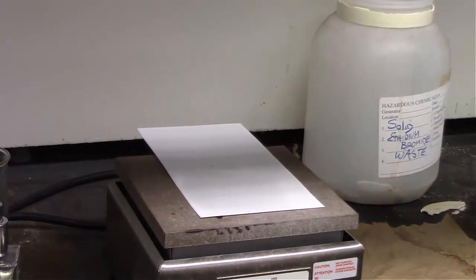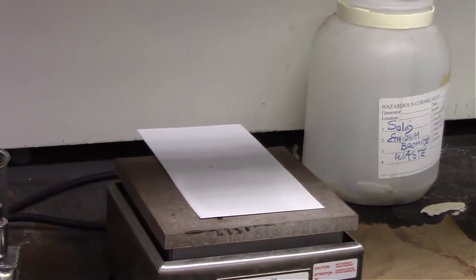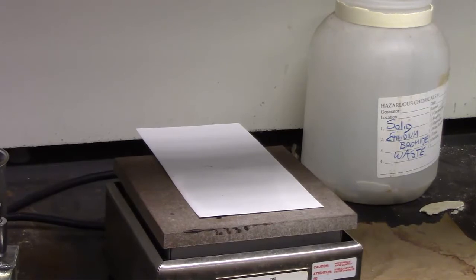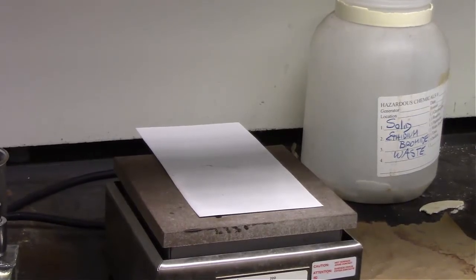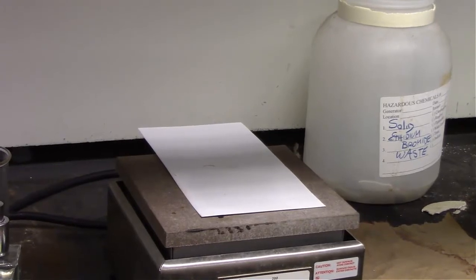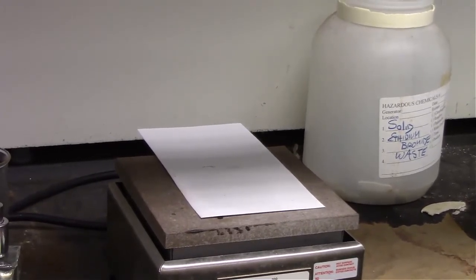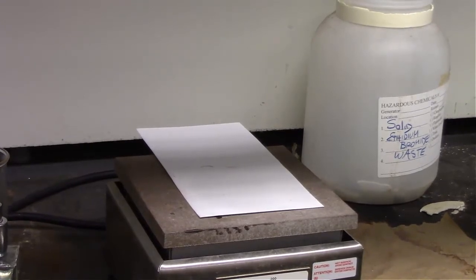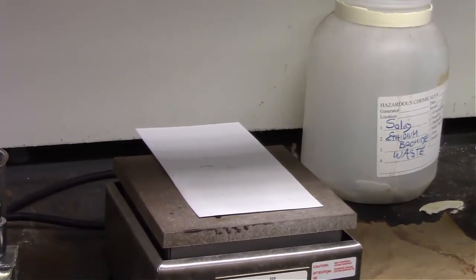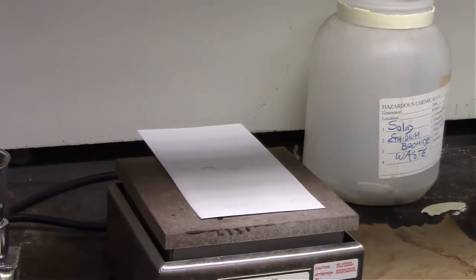So as the plate continues to warm up, you can actually see, if you look very closely, kind of in the shadow in the upper part of the plate, some spots forming. That's the center of the plate, so it's the hottest region, and you can actually start to see some of the amino acids. And those 2 amino acids that you see are actually our 2 unknowns. Based on the fold of the plate, it looks like the center is touching the plate a little bit more than the outside, so that's why that area is heating up quicker, allowing that reaction to happen quicker.